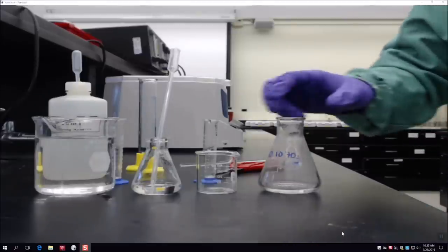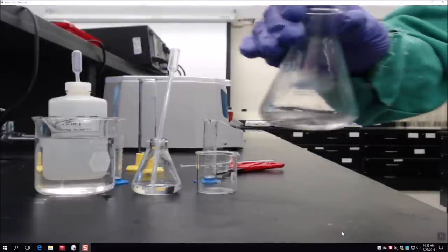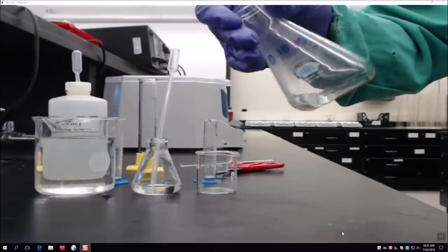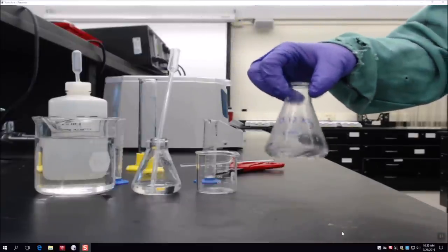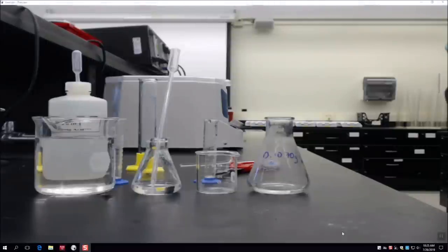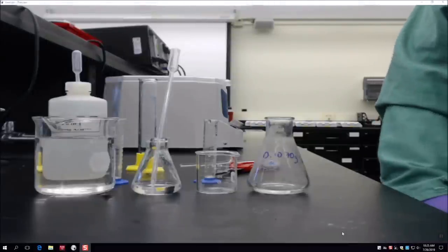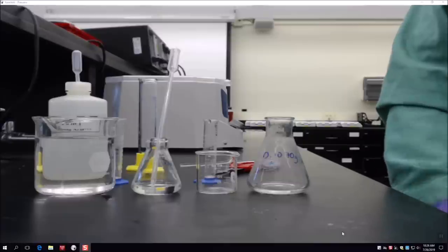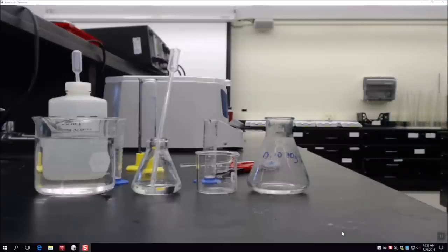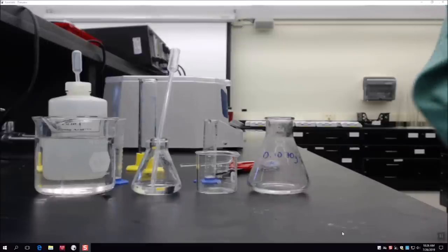A couple of minutes later, looking at the flask, there is no solid magnesium metal left — our first reaction is complete and we can move on. Before I perform any of the other reactions, I'm going to send it back to Colin, who's going to talk about how to calculate theoretical yields and discuss the next reaction before we actually perform it.